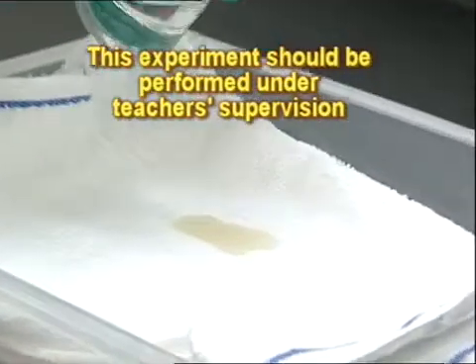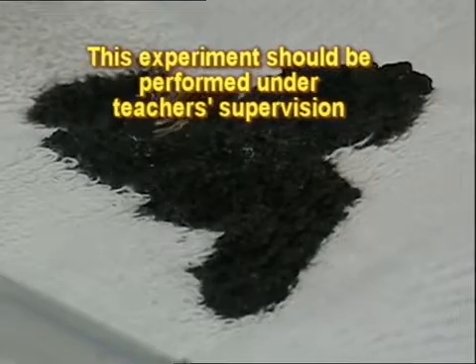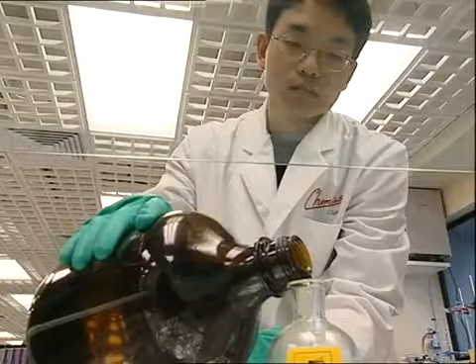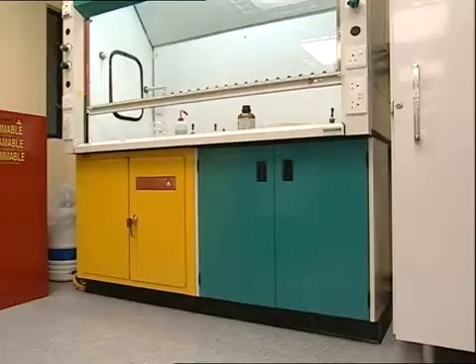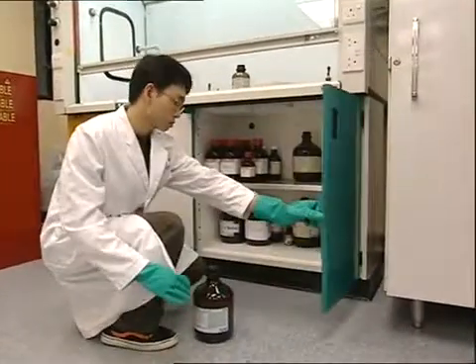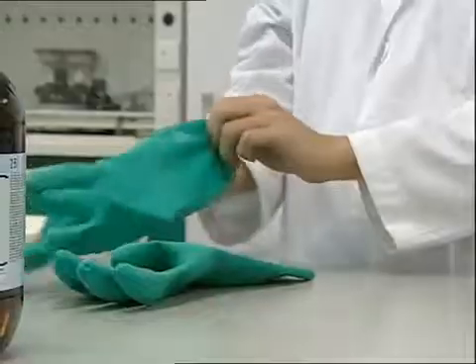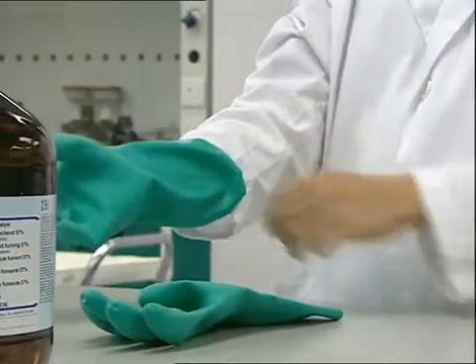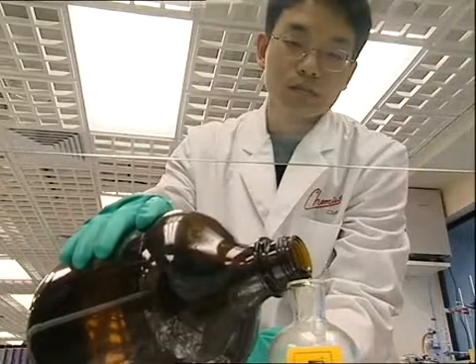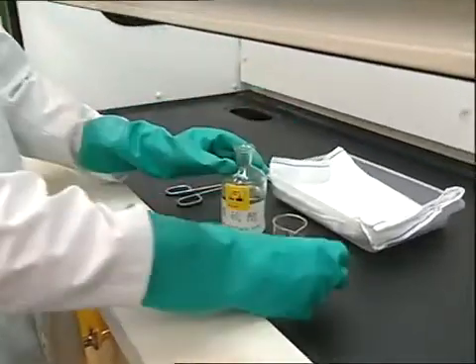If we drop concentrated sulfuric acid onto a piece of fabric, it burns a hole. So we should always exercise extreme care when handling strong acids and strong alkalis. They should be stored in the lower shelves of the cabinet to avoid any harmful destruction caused by spilling from higher positions. Gloves must be worn when using them. To avoid inhaling the fumes or burning your skin, do not place them close to your face. They should only be used in places with good ventilation.